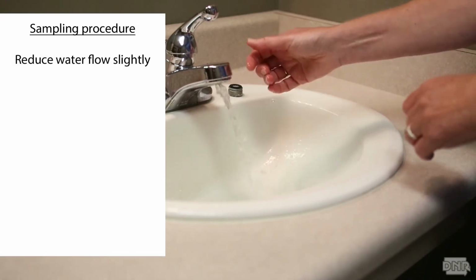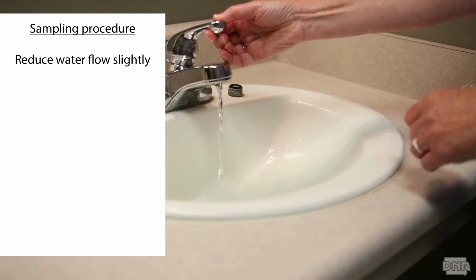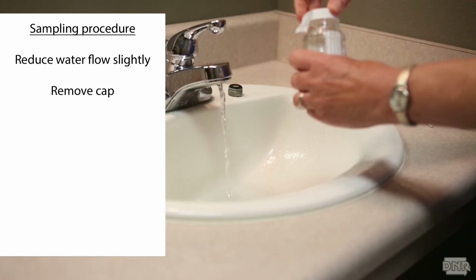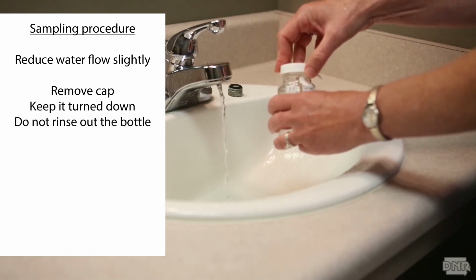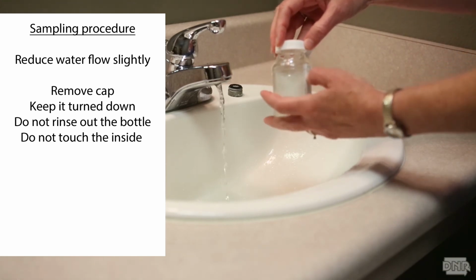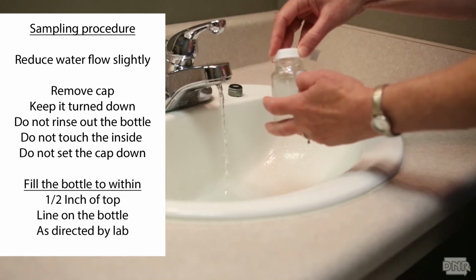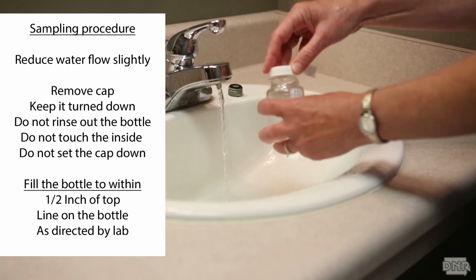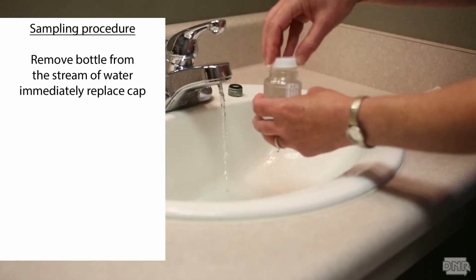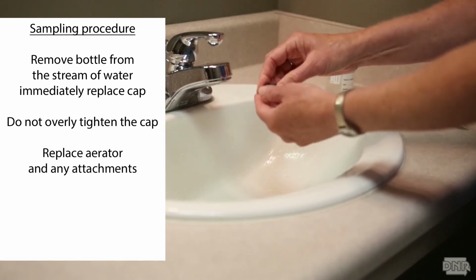Reduce the water flow slightly to about a pencil width. Ensure that the water does not splash, but do not adjust the flow while you're doing the sampling. Remove the cap and keep it turned downward. Do not rinse the bottle, do not touch the inside of the cap or the lip or the inside of the bottle, and do not set the cap down. Fill the bottle to within half an inch of the top or to the line on the sample bottle or as directed by your certified lab. Remove the bottle from the stream of water and immediately replace the cap. Do not over tighten the cap or it may split. Replace the aerator or any attachments.